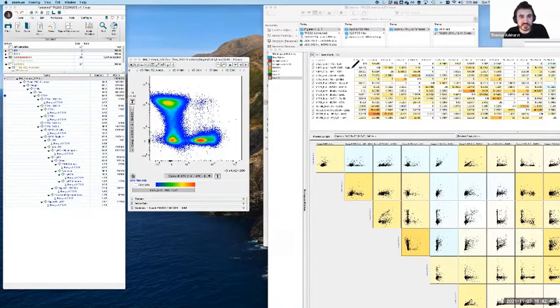So if I have this situation, where do I go from here? Well, there's a couple of options. One is I can ask, because there's always going to be some level of spreading error anytime you're performing compensation, is this really affecting my assay in a way that matters? In this case, probably not. I think the separation of whatever spread is happening here is pretty minimal. It's not really going to ruin my day with my assay. If this got much brighter than this, as it continued to go up, that actually could ruin my day. So there are definitely situations where you might decide we need to fix this.